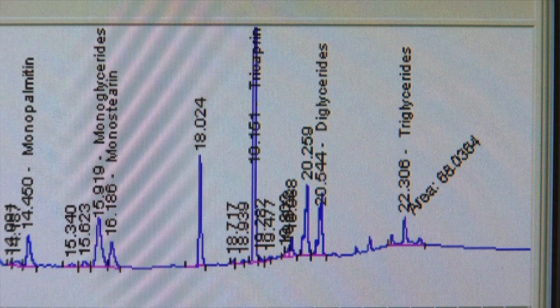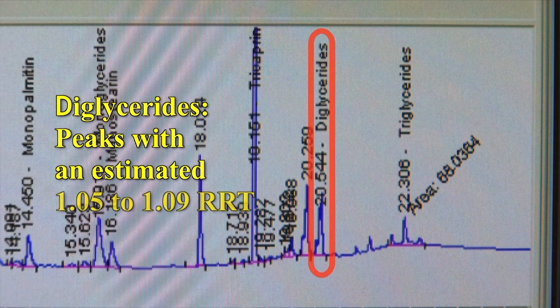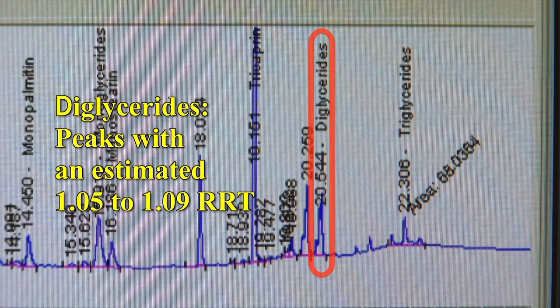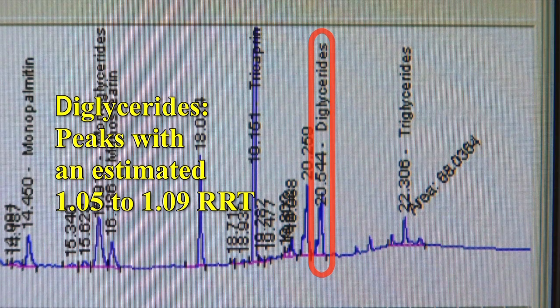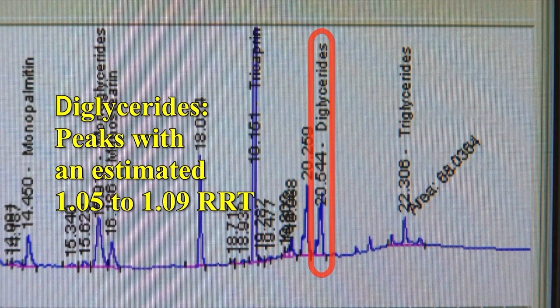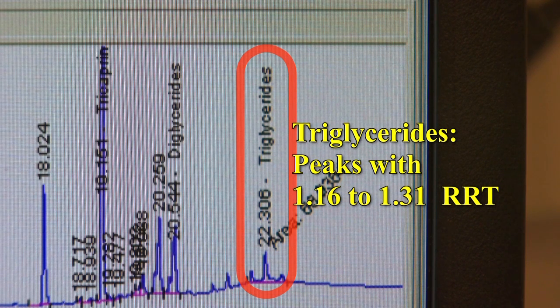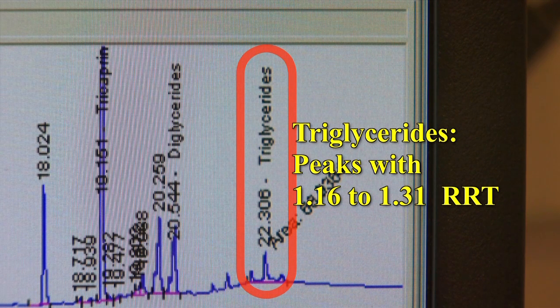Diglycerides are also primarily separated according to carbon number. Peaks with an estimated relative retention time of 1.05 to 1.09, carbon numbers 34, 36, and 38, should be included in the calculation of diglycerides. In the event of peaks overlapping or poor peak resolution, the grouping of 3 to 4 peaks with relative retention times of 1.05 to 1.09 shall be attributed to diglycerides. Triglycerides are separated by carbon number as well. Peaks with relative retention times of 1.16 to 1.31, carbon numbers 52, 54, 56, and 58, should be included in the triglycerides calculation.